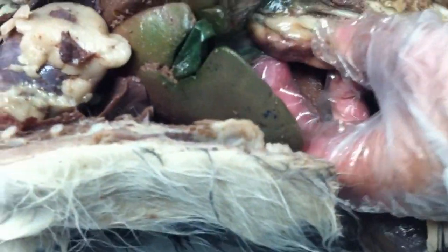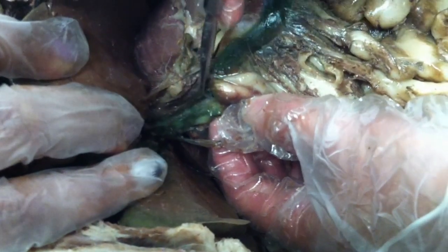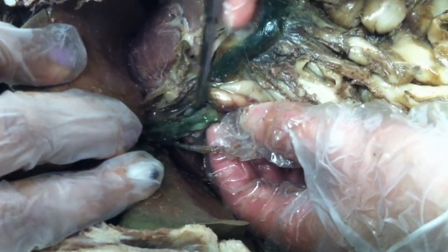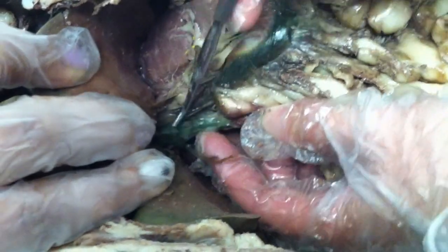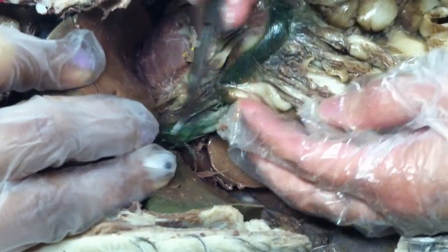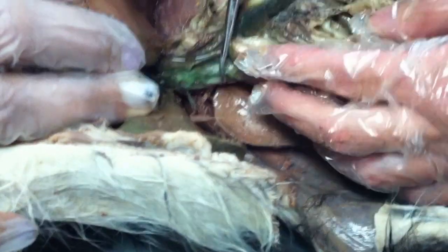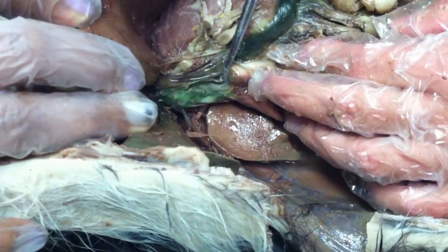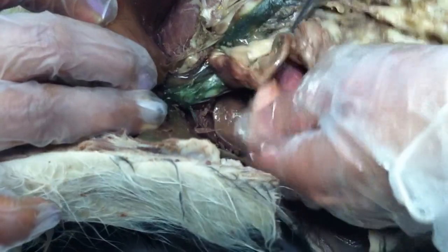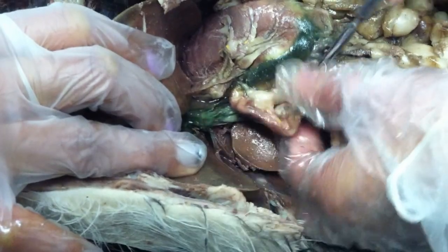I will do this one actually. So this is what you do. You hold that part and try to break the membrane with the probe. That's the cystic duct going from the gallbladder. When it's from the gallbladder, that's the cystic. This part is already the common bile duct. You see it ends in this part. Do you know which part this is?